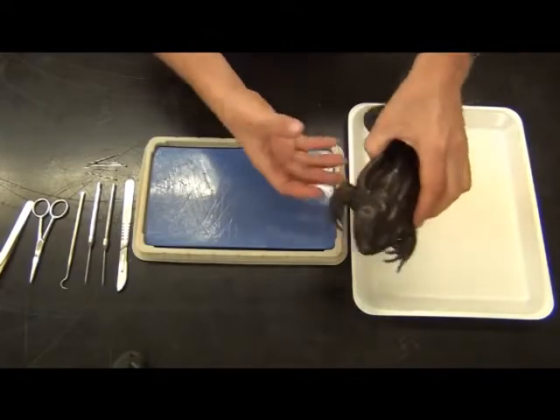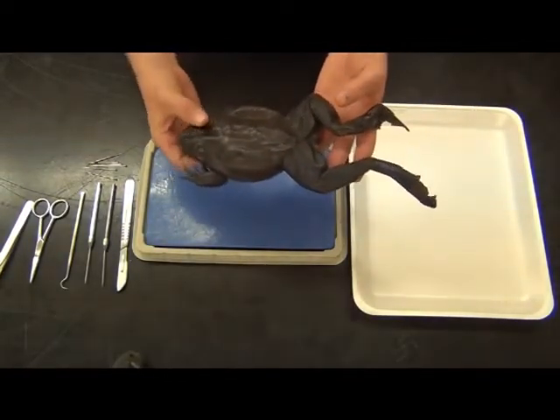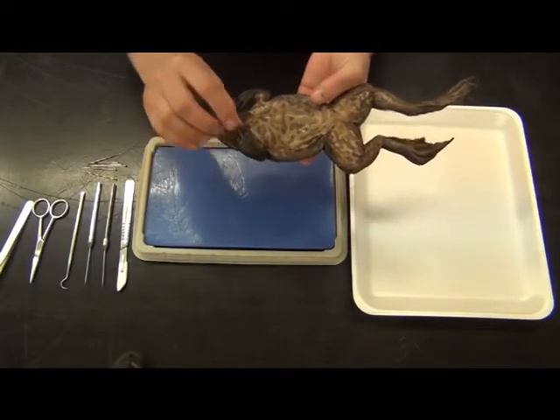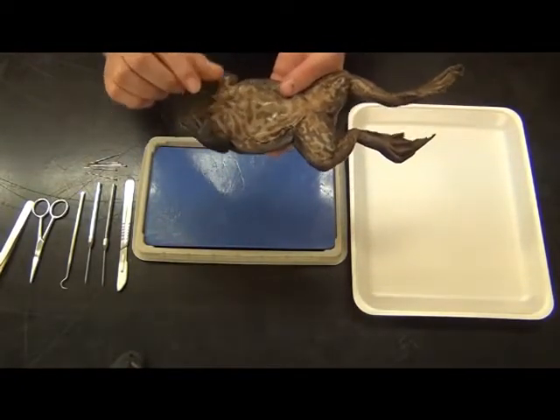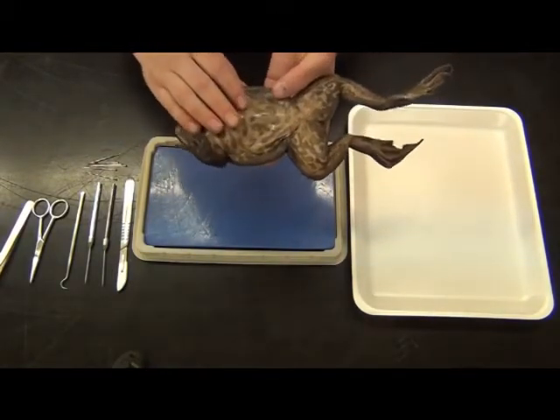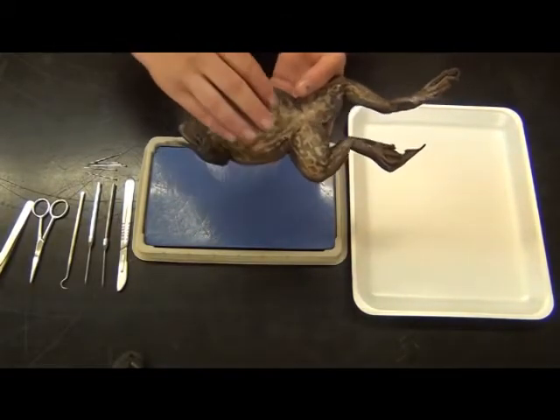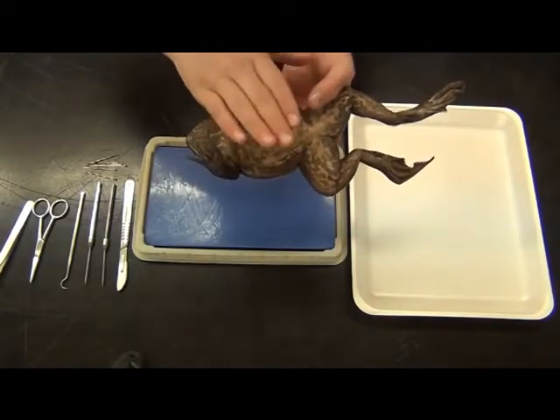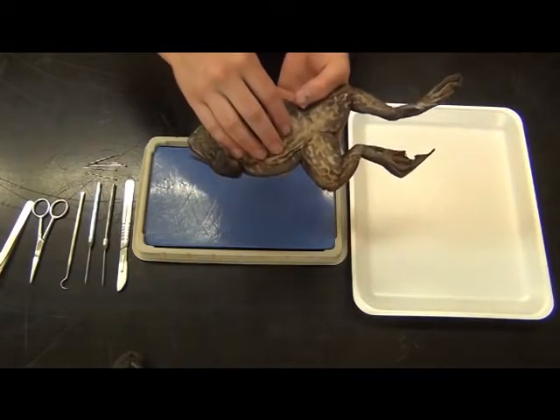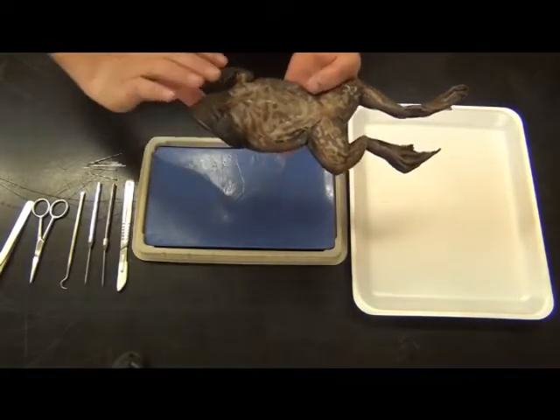Today we have a fairly standard bullfrog, about a foot long. You can pick these up at just about any scientific supply. Knowing if they're male or female just by looking externally — males will usually have a larger pad on the front legs, though you usually need several frogs to compare. A good indicator of a female would be a very distended belly; if they have lots of eggs inside, the skin protrudes and you'll find thousands of tiny eggs. Today I believe it's a male — we'll find out in just a moment.